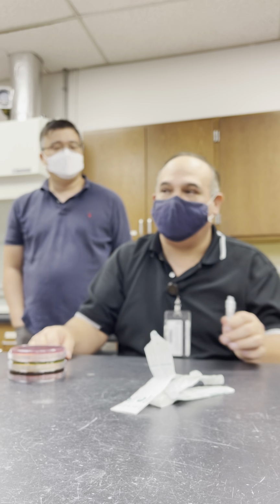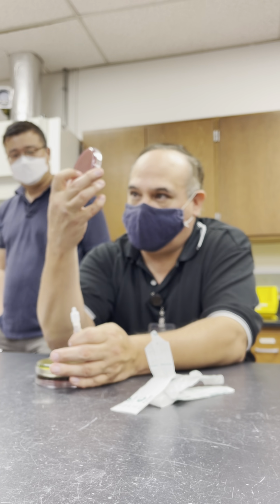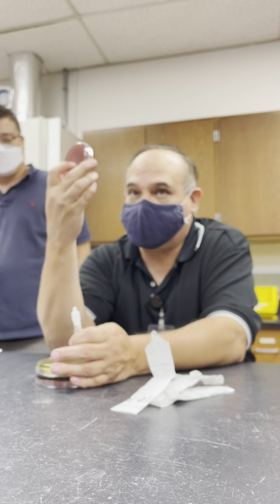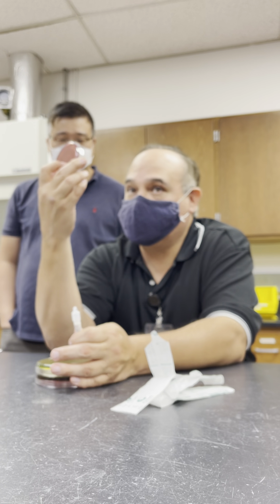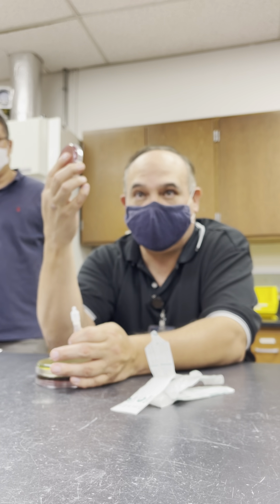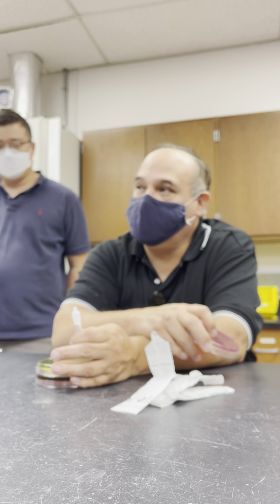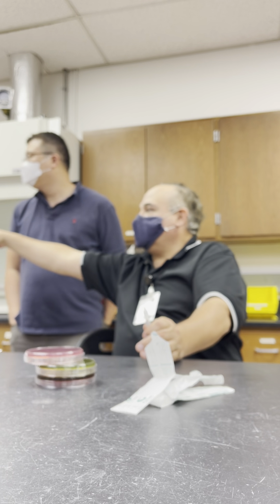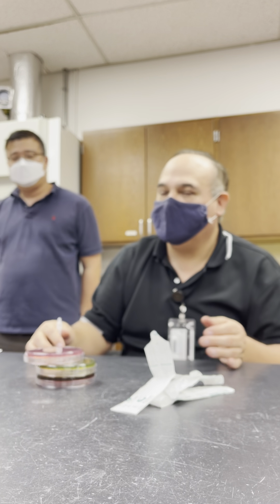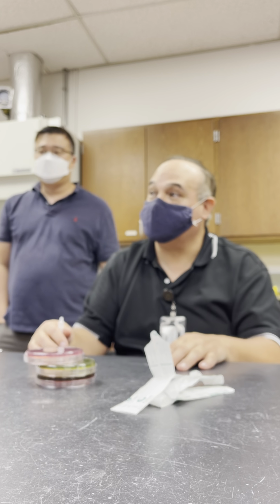And the reason for E. coli on MacConkey is because if you have a red color in here, it's a lactose fermenter. No color, lactose non-fermenter. But if you have a lactose fermenter and it has cloudiness in the media around it, that's called bile precipitate. And in this lab, only E. coli and Citrobacter do it. And it's right down there. See it? E. coli, Citrobacter. So if we were doing unknowns, we're not doing an unknown, but that would be a real quick characteristic that you could work with to figure out what the organisms are.